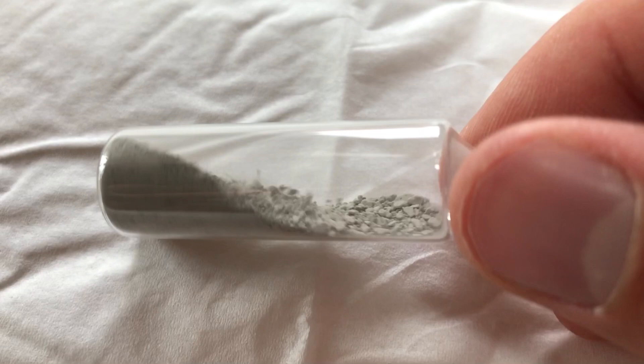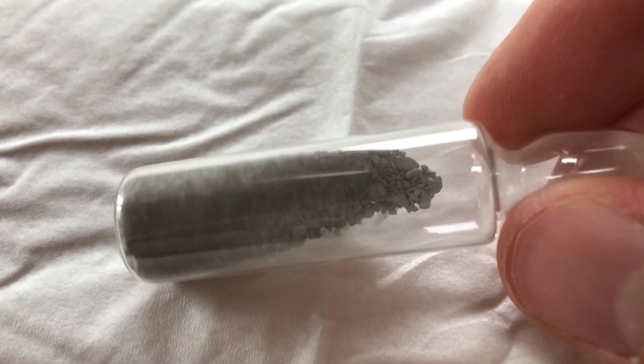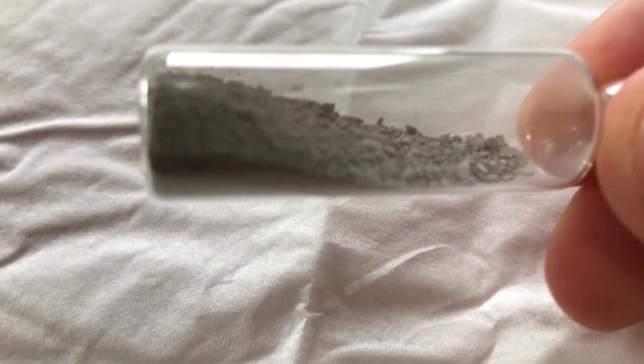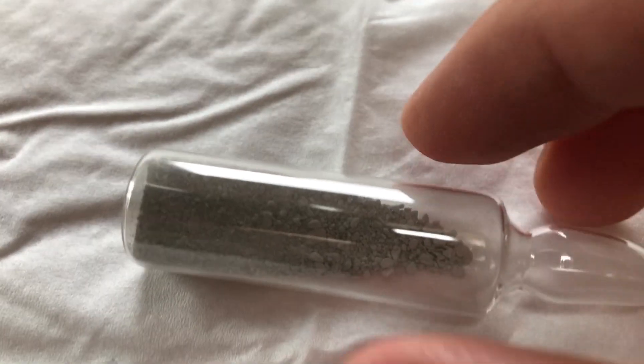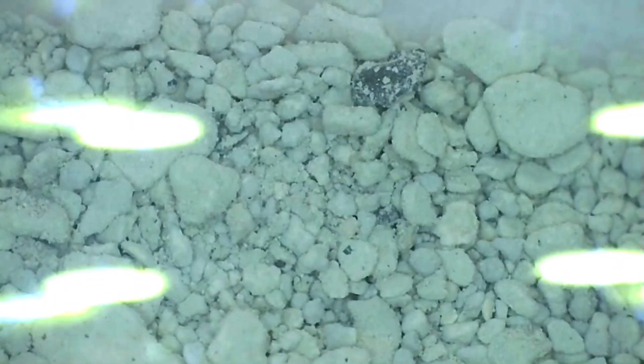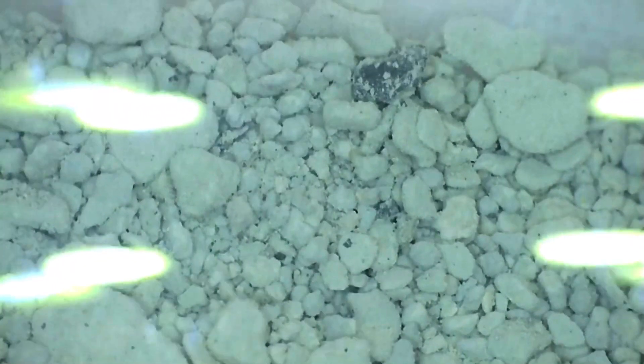Unfortunately there's no easy way for me to get rid of the starting oxide other than repeating the experiment. Fortunately this is only needed for an element collection and the spots of product which we desired are visible under a microscope.